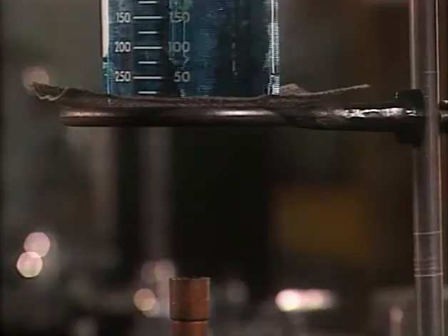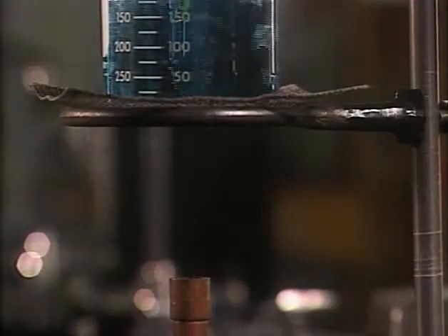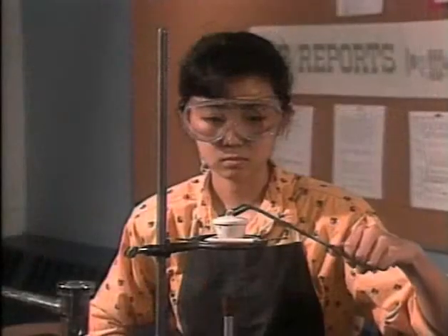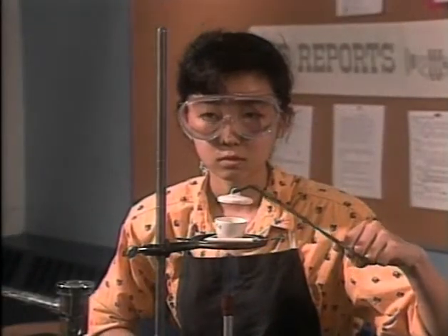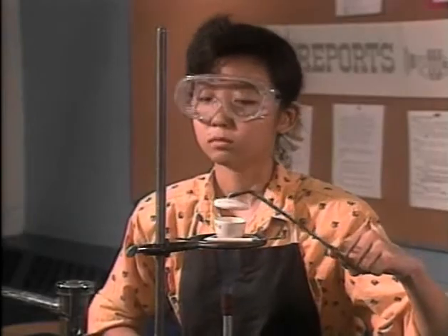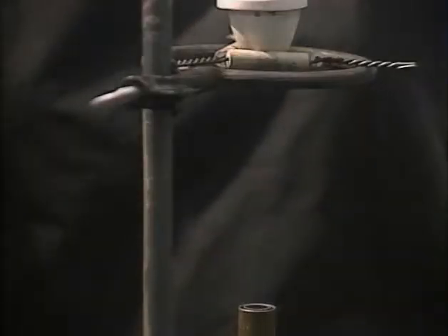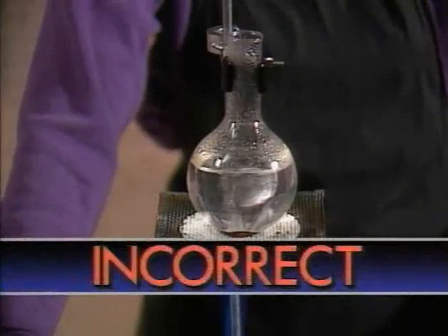If the flame begins to sputter or flare, turn the gas off immediately. Also turn the gas off immediately if the flame goes out — unburned gas escaping into the room could ignite and cause an explosion. Even when the burner seems to be working properly, if you smell gas, turn it off. Cracks or stars in glassware are dangerous — they can break open when heated.